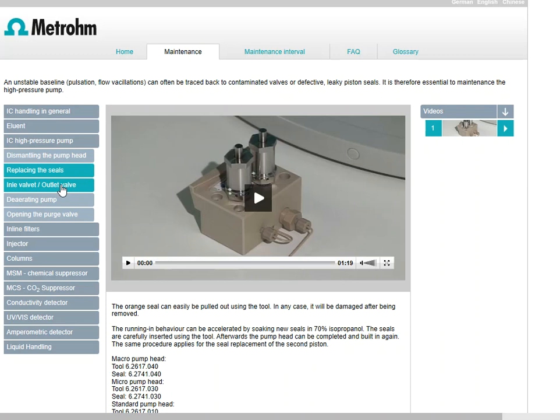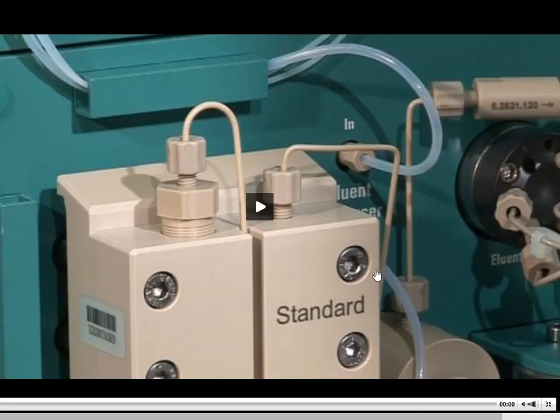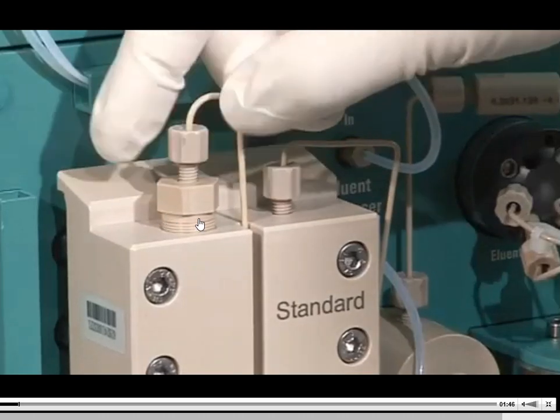Now what we're going to do is click on this inlet valve and the outlet valve. Notice how they spelled it "inlay valvet." I guess they left the T off inlet, and that T went on to the word valve. So let's take a look at the inlet valve and the outlet valve for the IC instrument. I'm going to blow this up a little bit for you, and we're going to take a look at how to do maintenance on these pieces too.